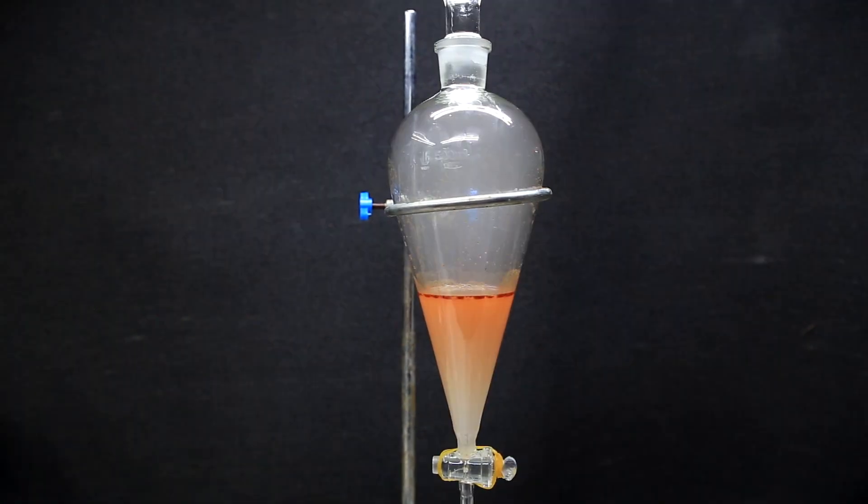You can see that when it's allowed to stand, an oil seems to appear at the top. This is good because at around room temperature, phenylhydrazine freebase is an oil that's immiscible with water. You should also notice that the water took on a little bit of a red color and this is because there's some of the phenylhydrazine freebase dissolved in it.